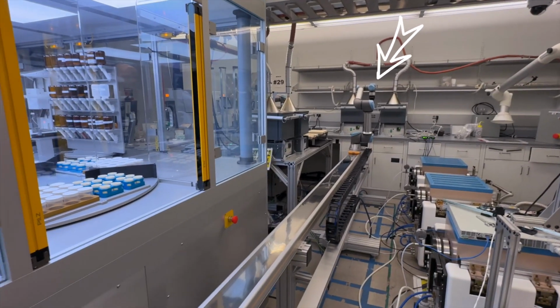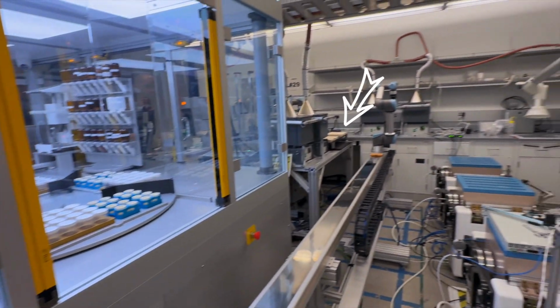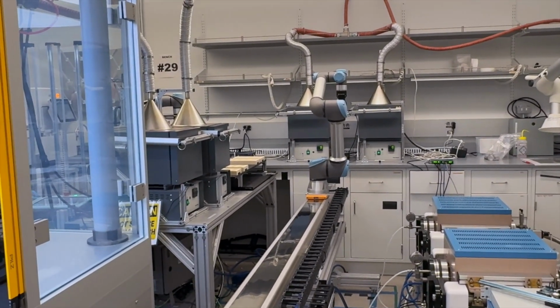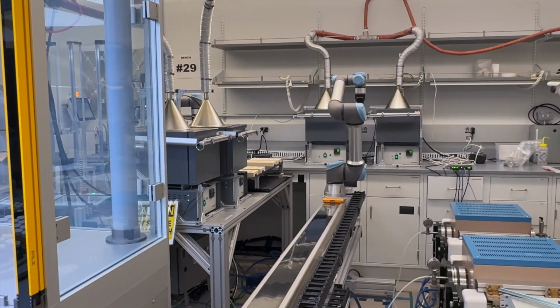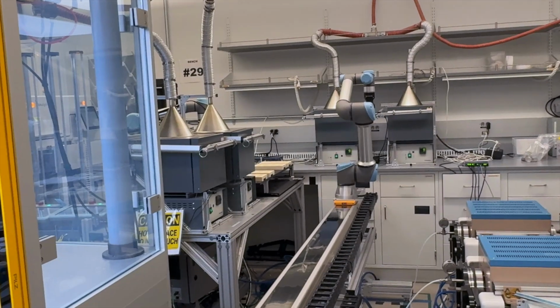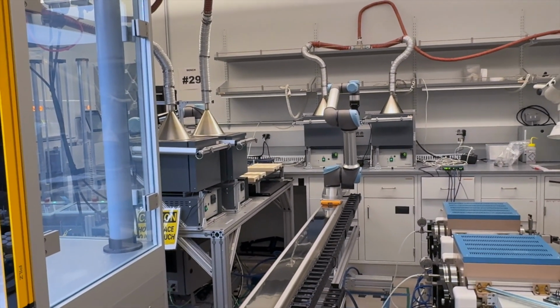they come to this window where that robot arm comes and picks crucible by crucible and brings them to the ceramic racks there, and they go inside the furnaces. Wow. So we can do up to 8 samples at a time. So these are the famous furnace doors? Yes, they're the ones. So then they go inside the furnace.